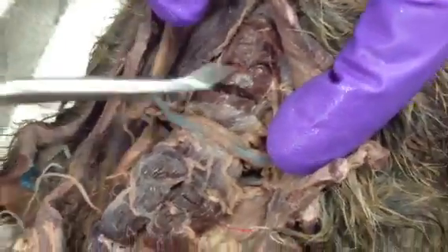And then whenever you look underneath this, there's gonna be like a really thin layer that you're gonna get confused with and think maybe it's part of the mylohyoid, but it's just a part of a neck muscle like the platysma. You don't need to know that word, but underneath that you'll be able to see the digastrics. And the digastric muscles are here. There's two of them on each side. That's why it's called digastric.